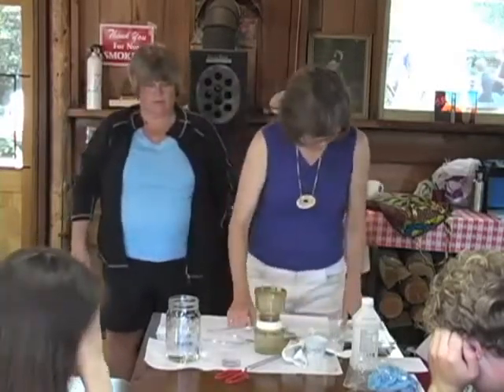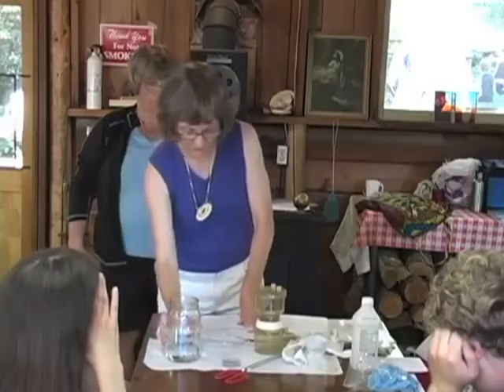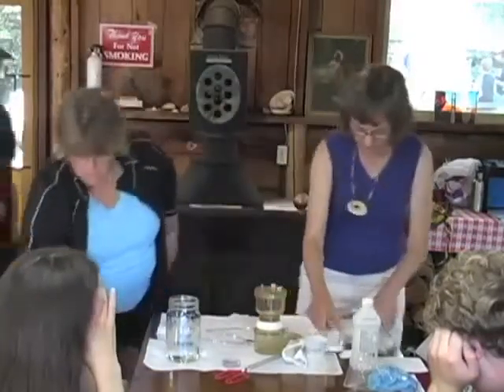All right, add a small amount of distilled water into the filtration unit through the top. This happens to be the distilled water, which is the same as our sample water, but that's not going to work. Okay, I'm going to need to draw some with the syringe.